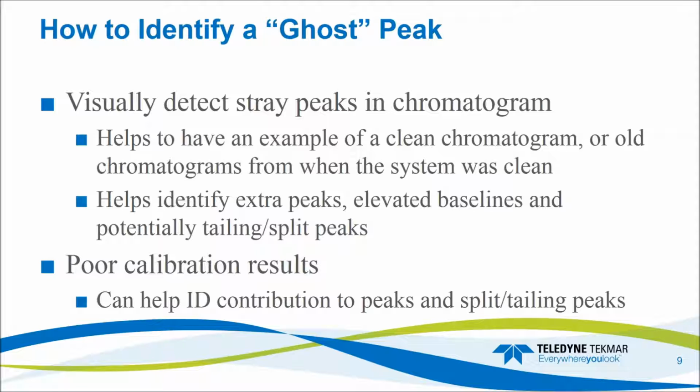a chromatogram from when the system behaved the way you expected, and then you can compare that to what you're currently seeing. And this can help identify in particular extra peaks or an elevated baseline that may have snuck up over time and you didn't notice, and then also tailing or split peaks. So a month ago, 6 months ago, a peak used to be nice and sharp, now it has a broad extended tail, or it used to be a single peak and now it's fragmented and split.